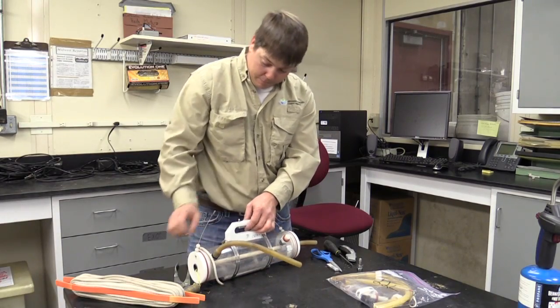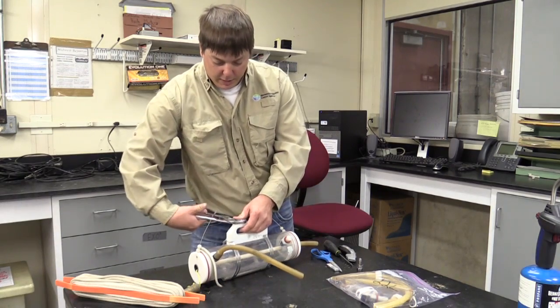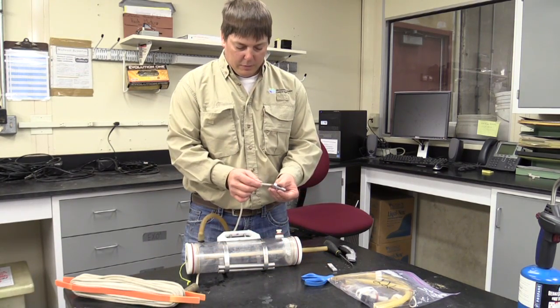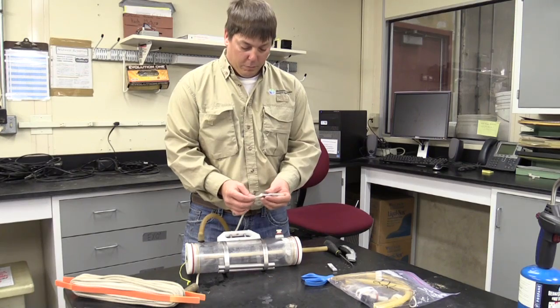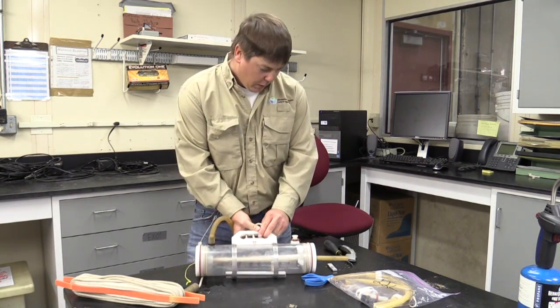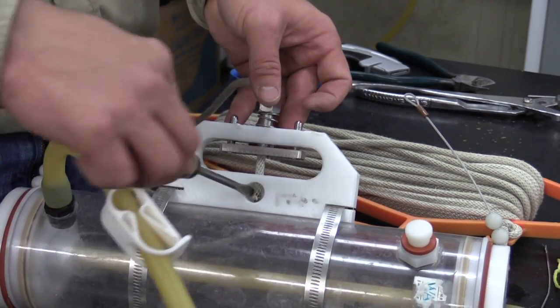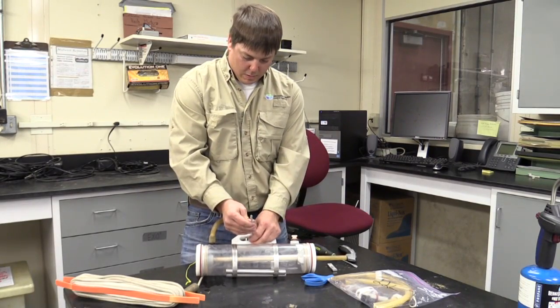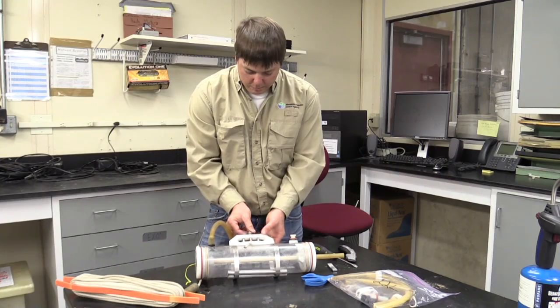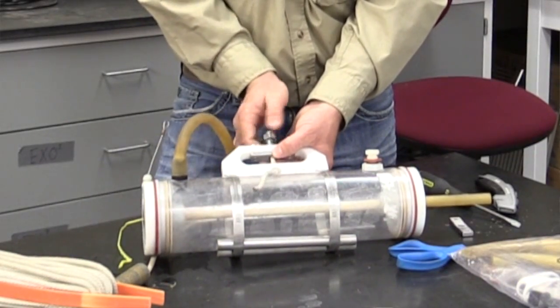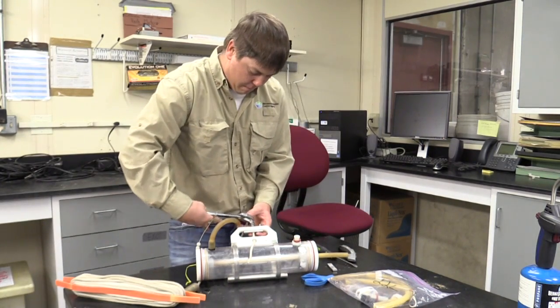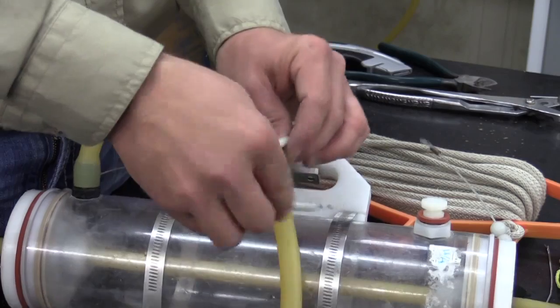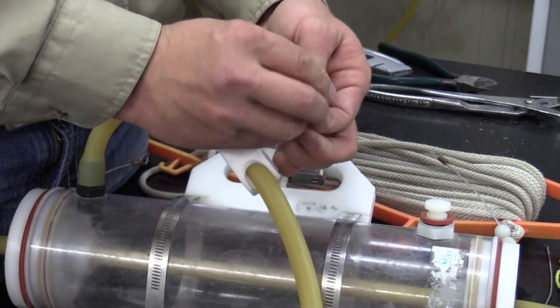Now when I screw these in, they don't have to be as tight as what they were as they came from the factory. I found it's easiest if you thread this rope through the bolt first. You'll have to use a little pliers, or in this case I'll just use a screwdriver to pop that out. And then with this top bolt, it should screw right down into there again. And again, just snug it up. Place a knot. That's how you replace the strike plate.